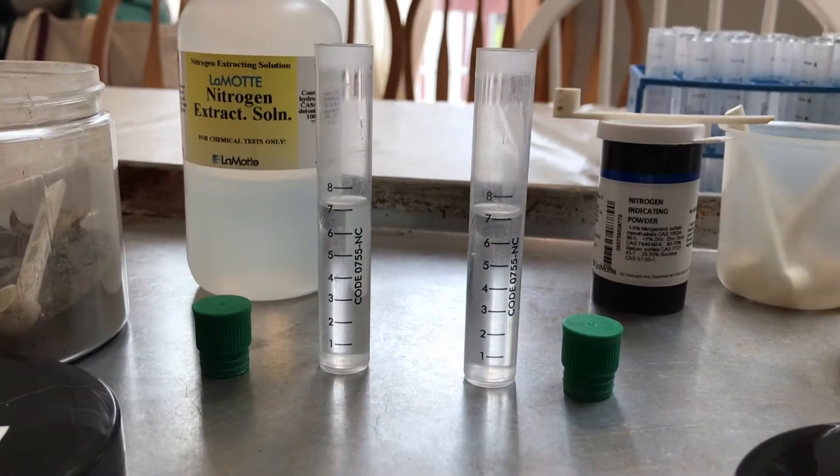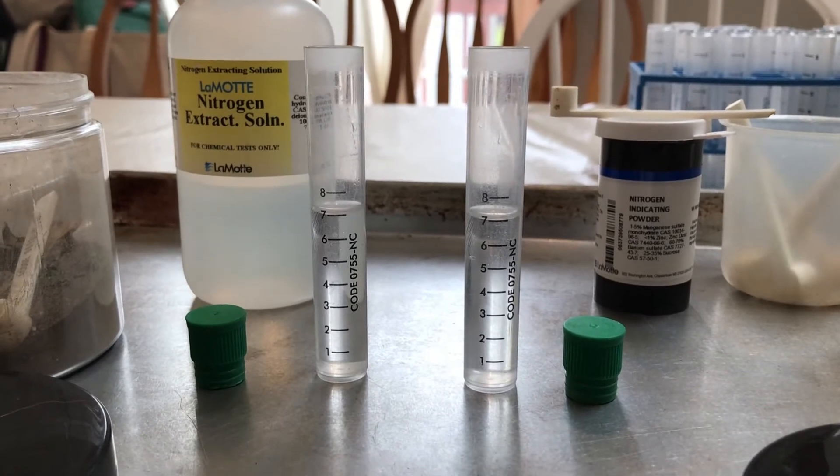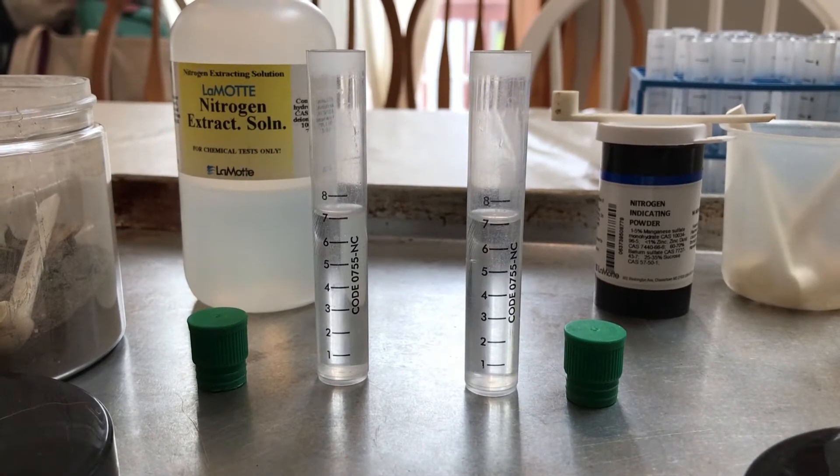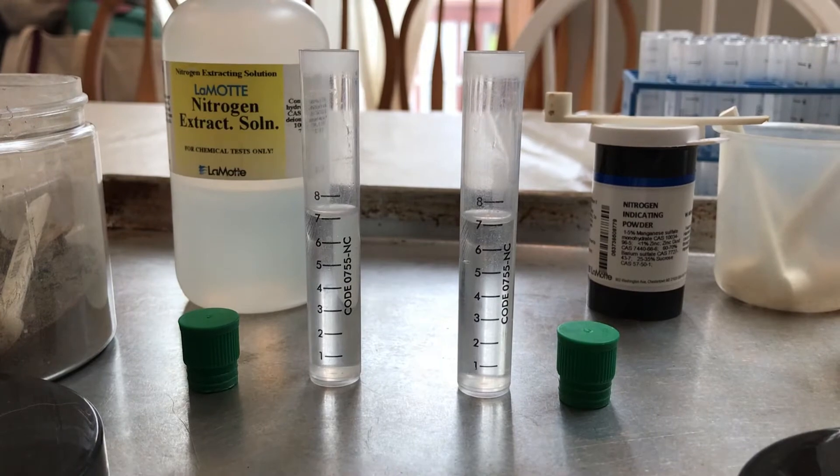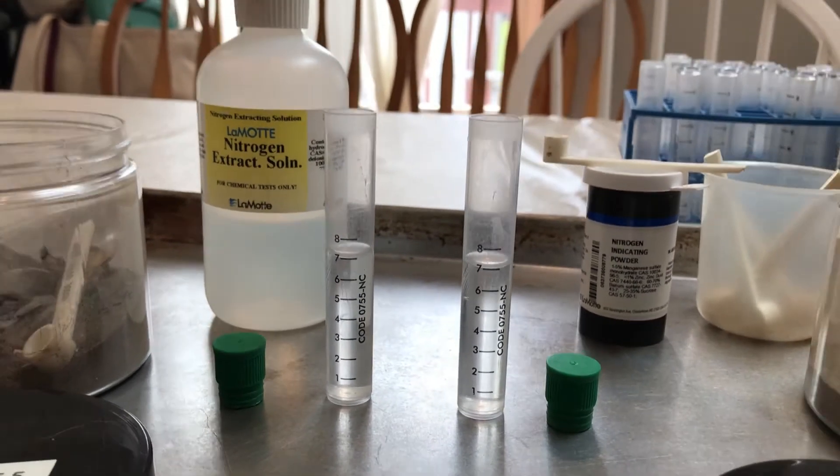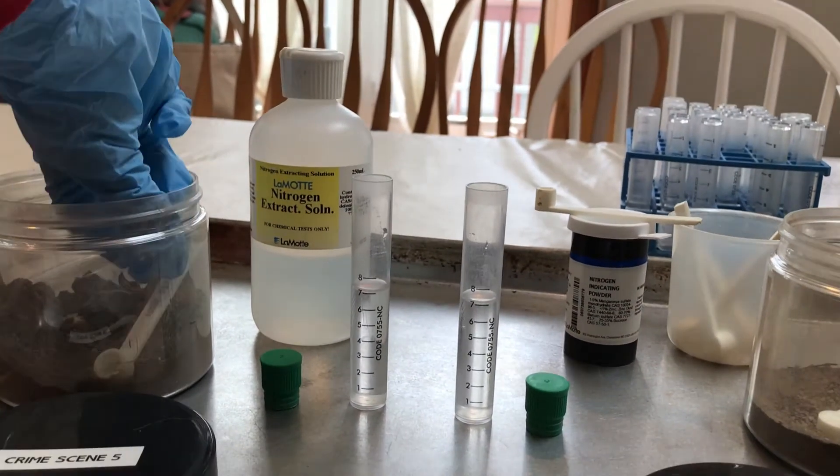So you see we've already added nitrogen extracting solution to our test tubes up to line number seven, and now we're just going to add one scoop of each soil sample.